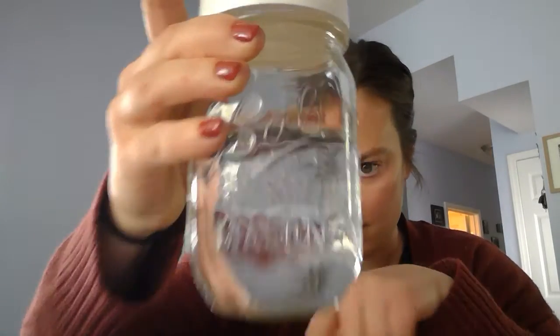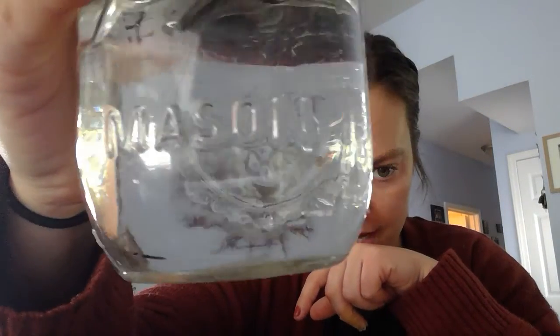Okay, here we have sample 1. I'll add that it doesn't really have a smell at all. It's clear, you can see through it. There were maybe some solids down at the bottom, but I do not really see any anymore. So what do we think might have contaminated this water sample?